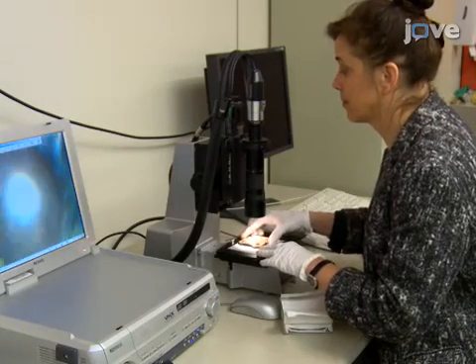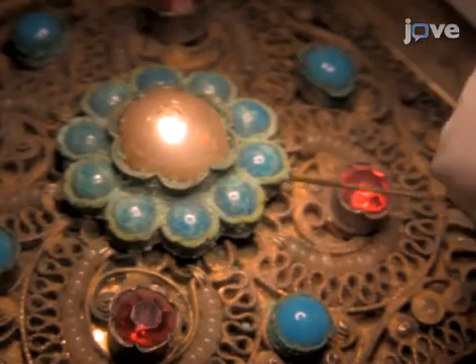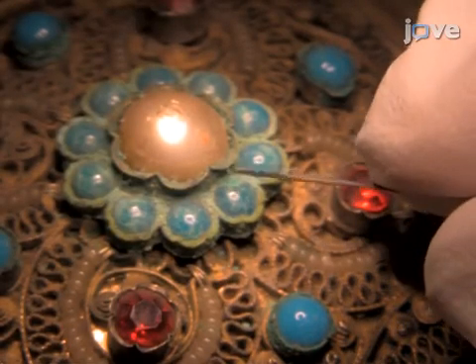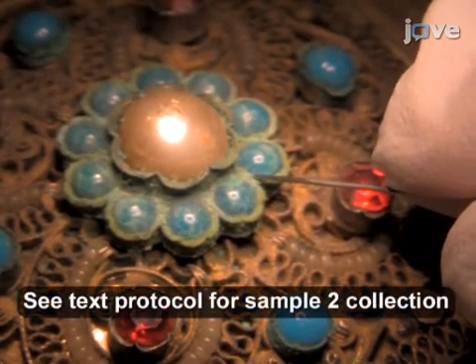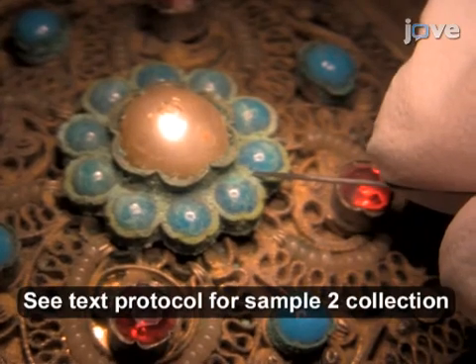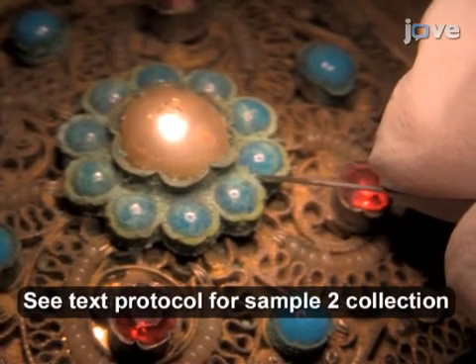Under a digital microscope, carefully pick less than 1 mg of sample 1 from opaque blue-green cabochons on a historic clasp using a fine needle.